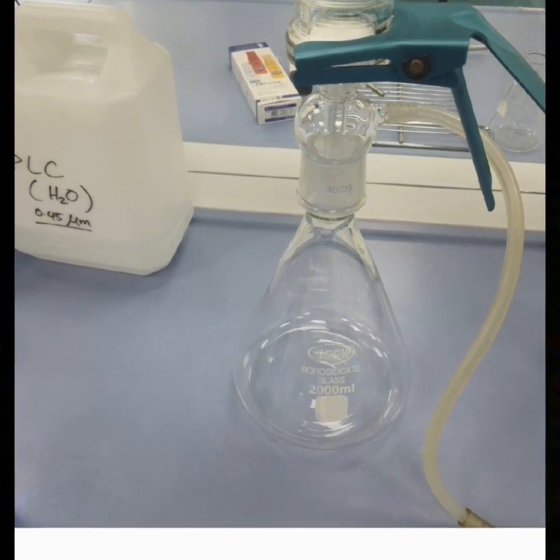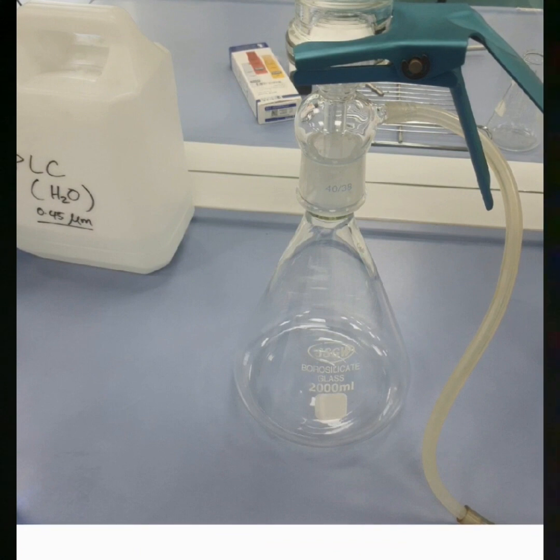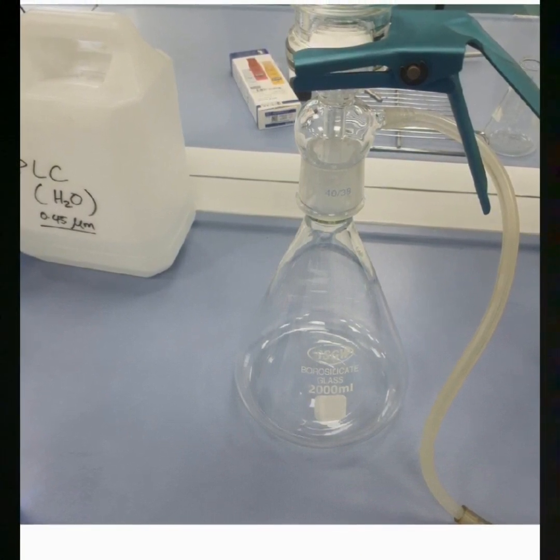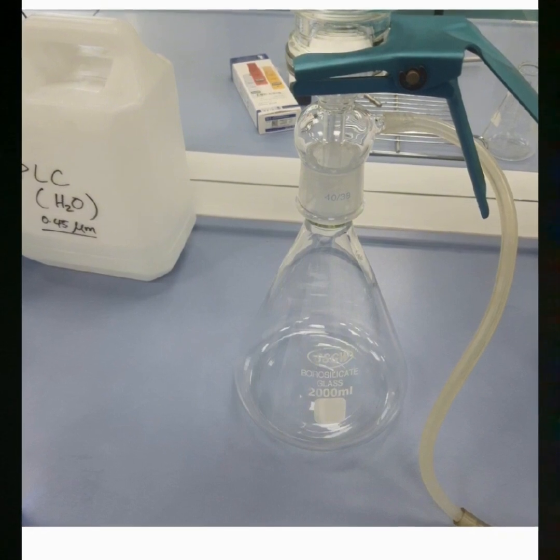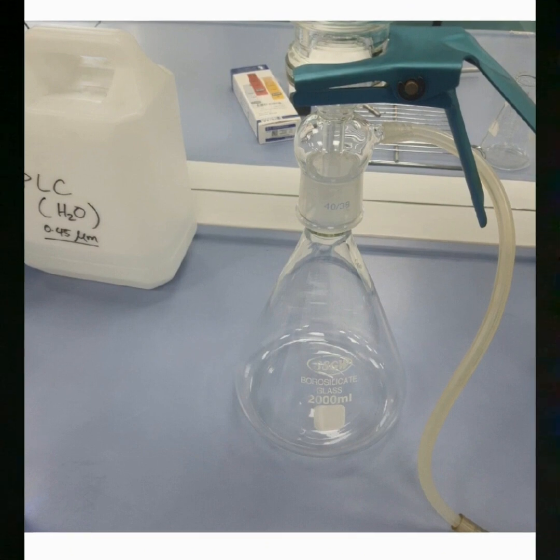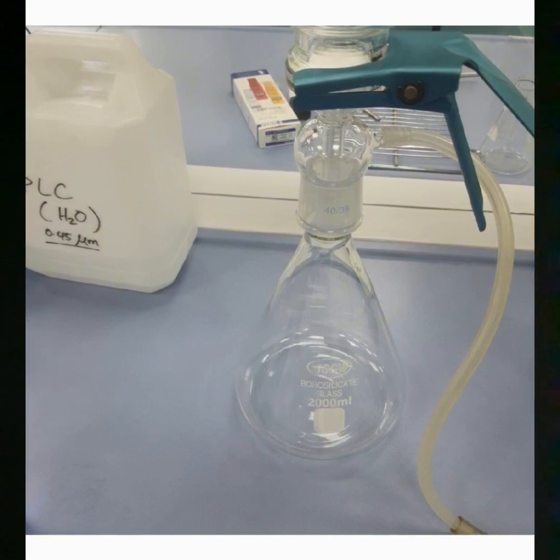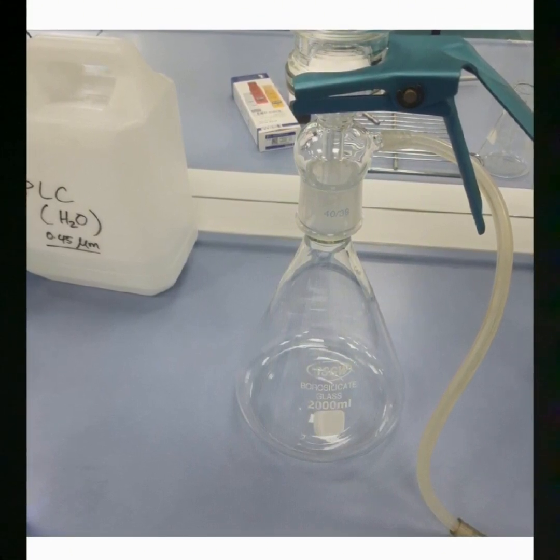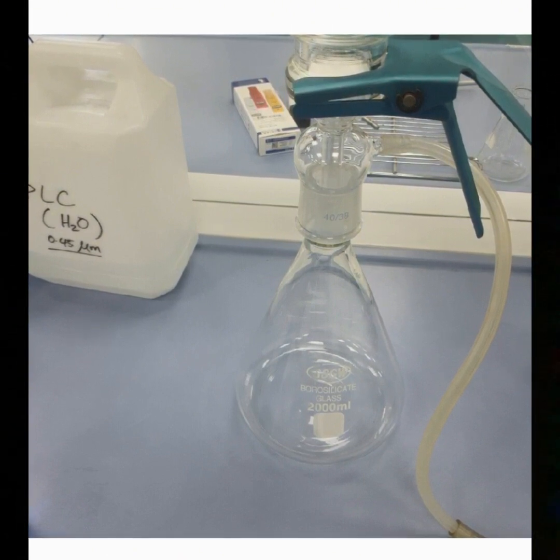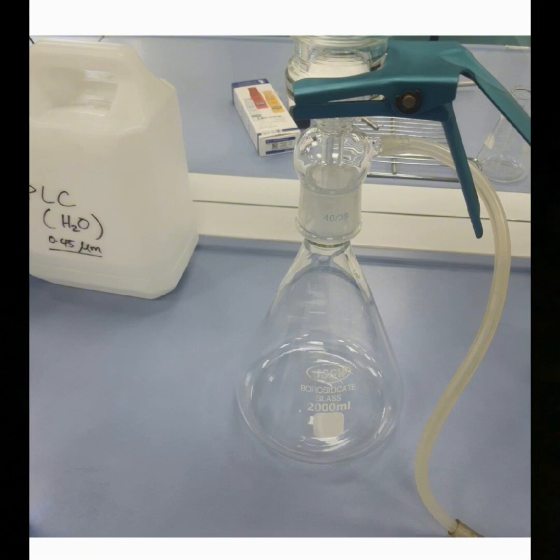The difference between vacuum and gravity filtration is timeliness and how they operate. Basically these are the two ways we can differentiate. One method uses a vacuum source in the case of vacuum filtration to power the filtration, while the other uses gravity. Okay, there are other mechanisms also to do the filtration. This is dead end filtration, and the cross flow filtration also.